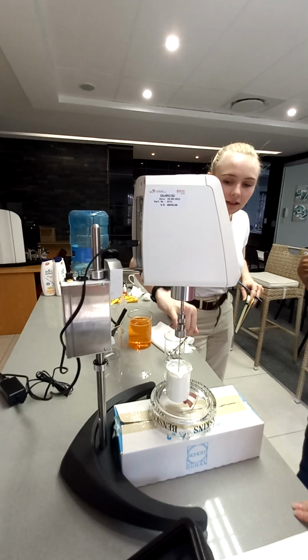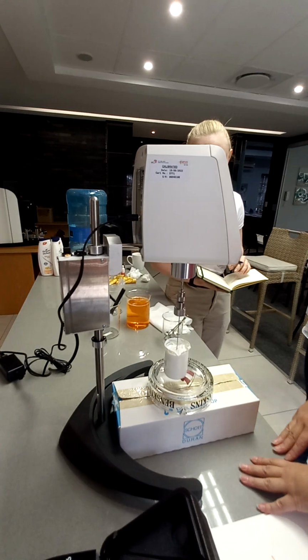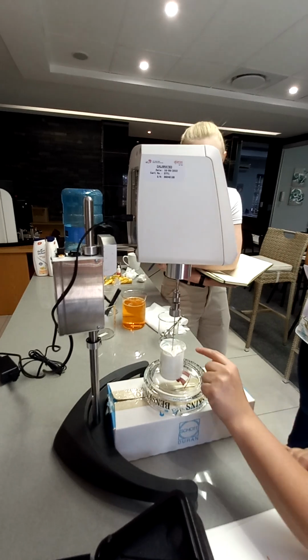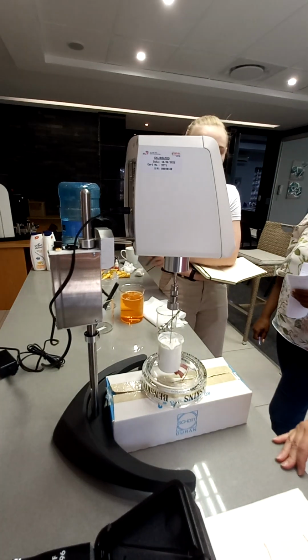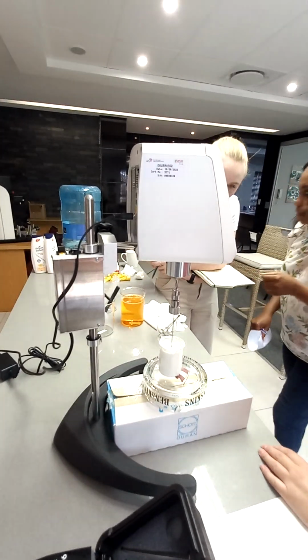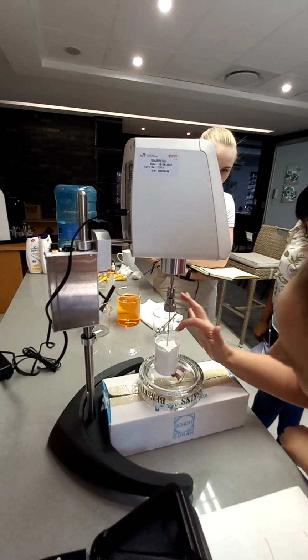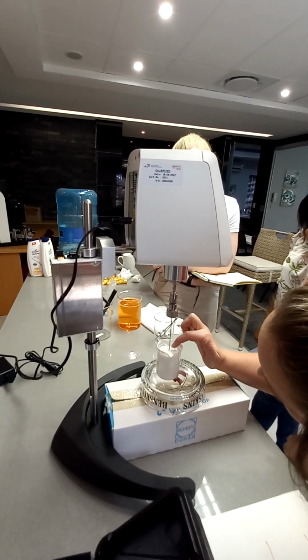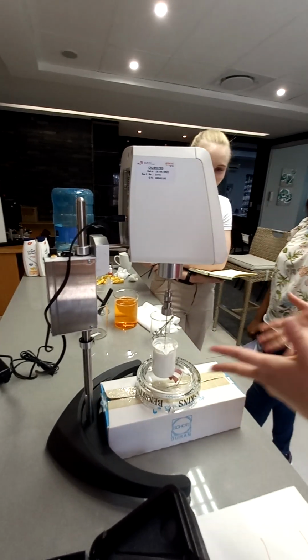So does the spindle need to be covered in the cream? You don't have to. It's not a must. I've just put it there. Otherwise, your top reading you might also take when there's nothing. But in any case, wait for it just to go in a little bit, and then start it. Because I can imagine you make a bit more air bubbles if it's not in. But you can be creative and say, okay, if this is my top, I'm going this far in. You can take a marker and say, when it hits that mark, you take a reading, that mark, and that mark. You have to decide how you want to do it.